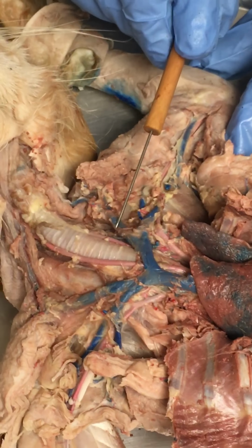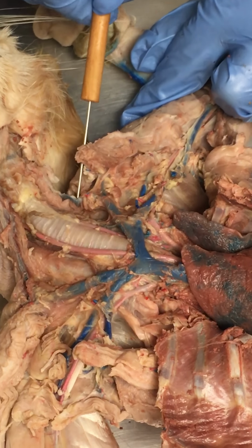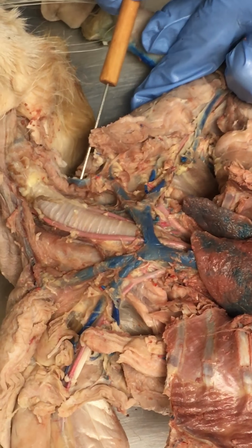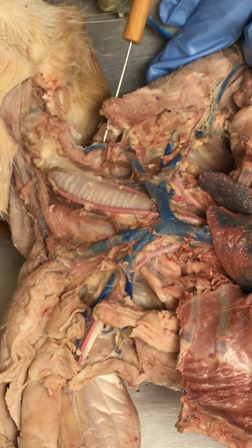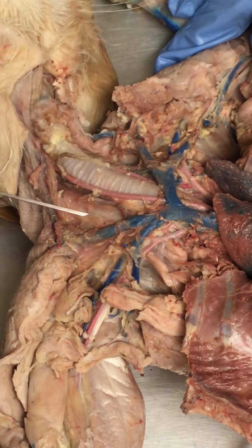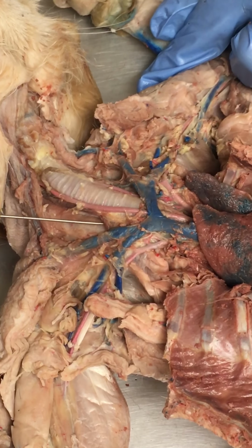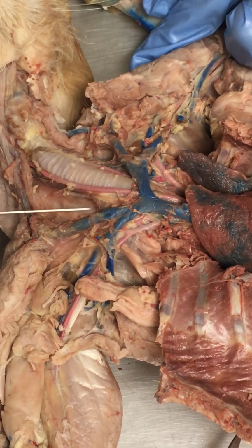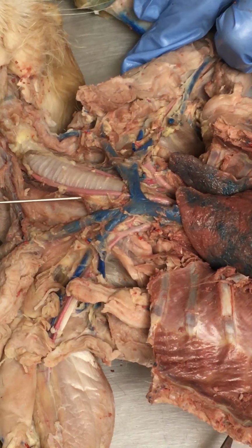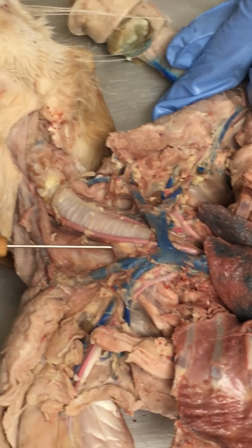This guy, where it branches and goes up, this is our jugular. The big one is our external jugular, and then it's a little hard to see that thinner little guy right there, smaller diameter, that is our internal. So that's our left external jugular and our left internal jugular. We've got the same thing over here on the right side. So here's our right external, and here's a case where we didn't get a lot of dye into one of the blood vessels. This is our right internal. So it has an attachment point right there, and it runs up the inside of our throat, essentially next to the esophagus, and that is our right internal jugular.